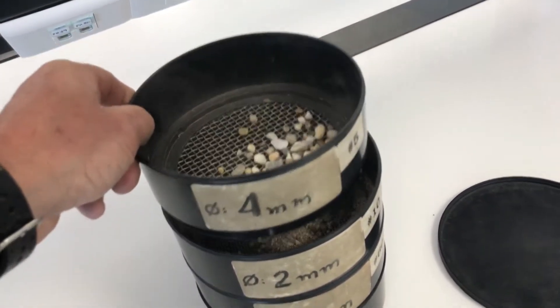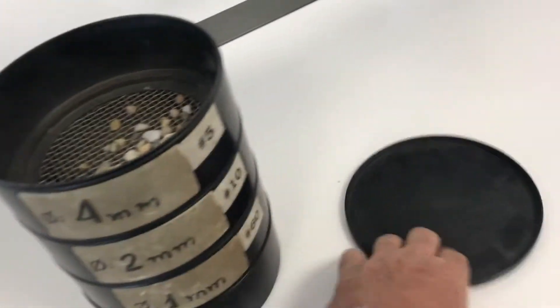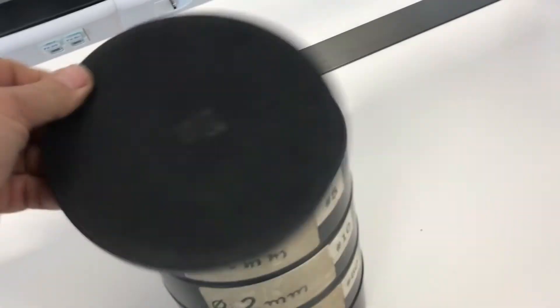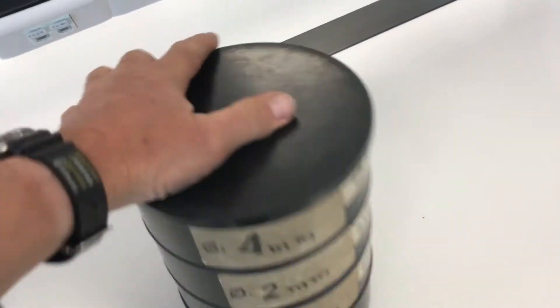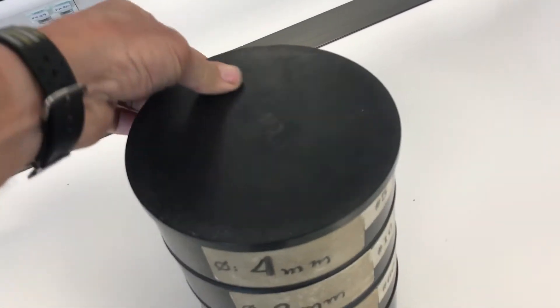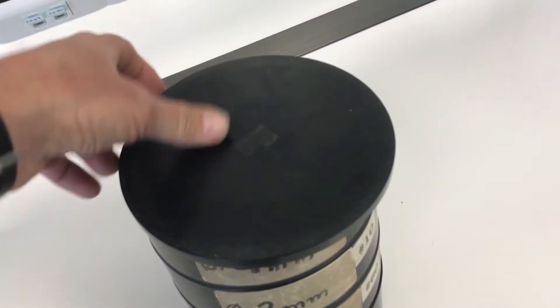And then we shake it a little. Okay, it's not a cake, okay.